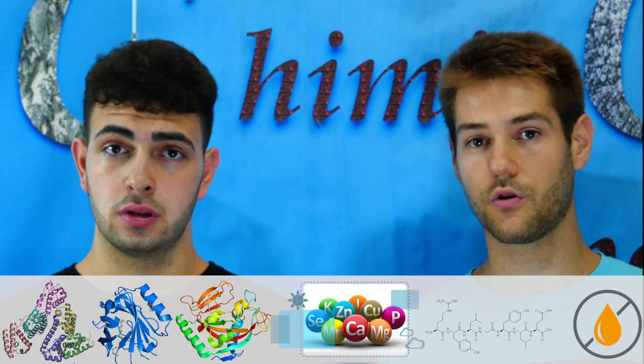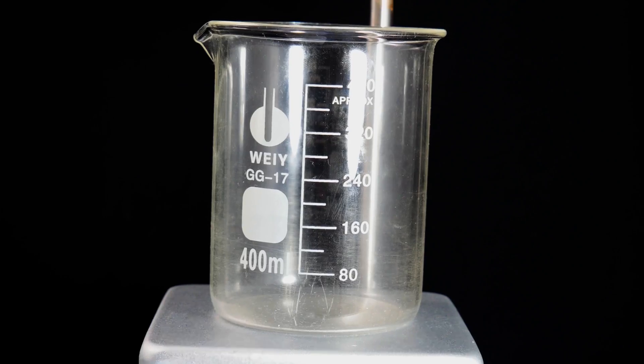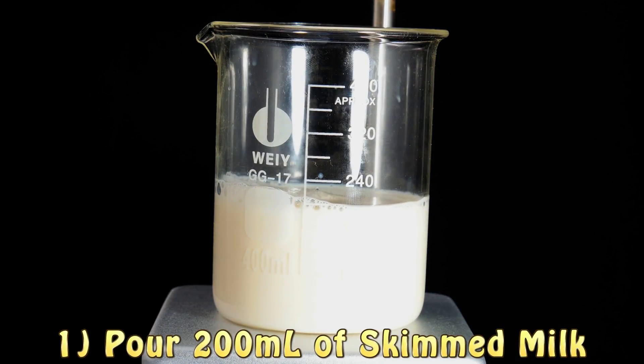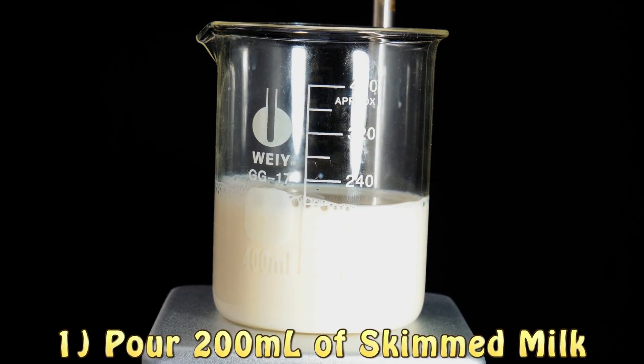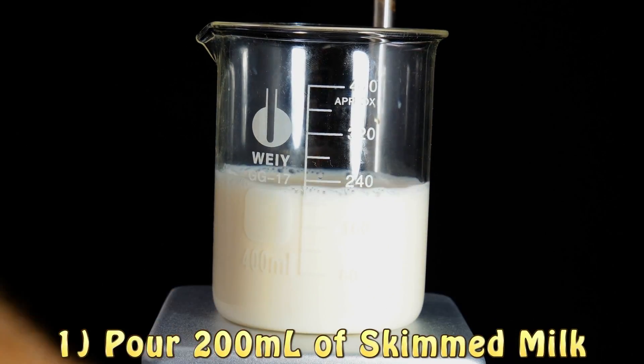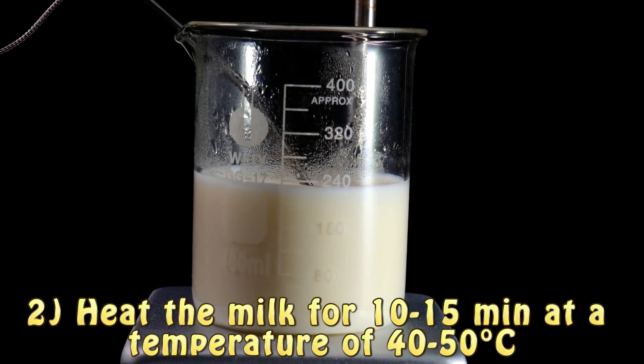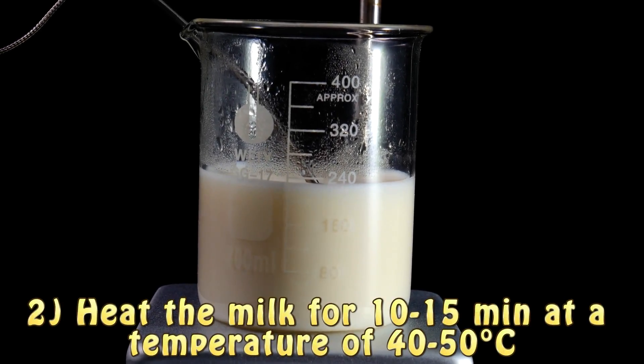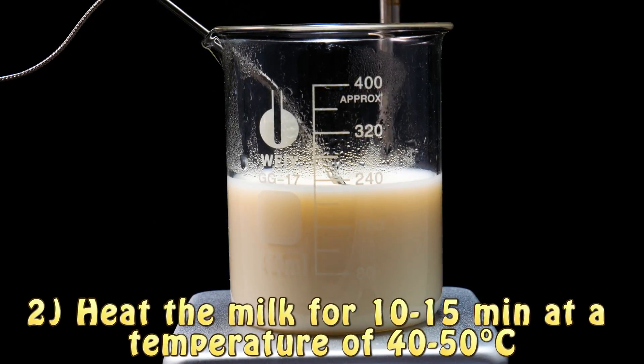For this experiment we are going to show you how you can separate them. The procedure begins by putting 200 milliliters of milk in a beaker. We place the beaker on top of a magnetic stirrer, stir the solution, and heat it up to around 40 to 50 degrees centigrade, leaving it like this for 15 minutes.